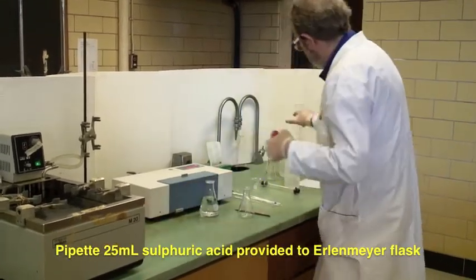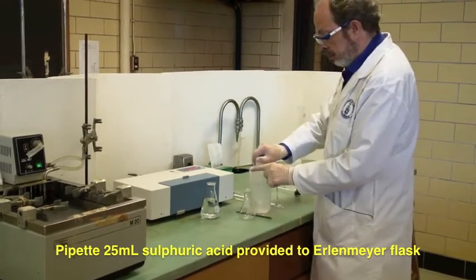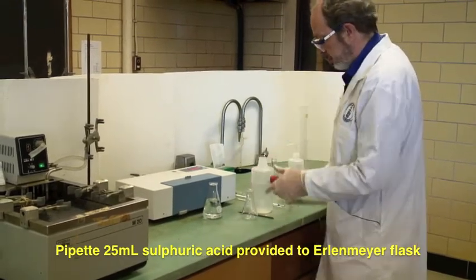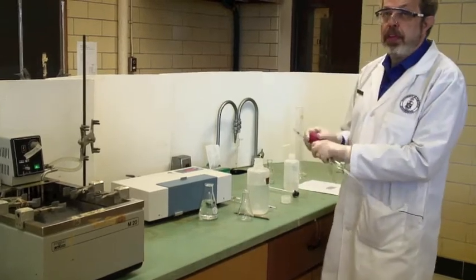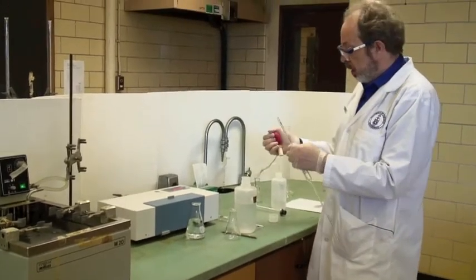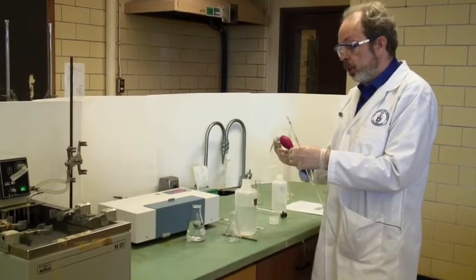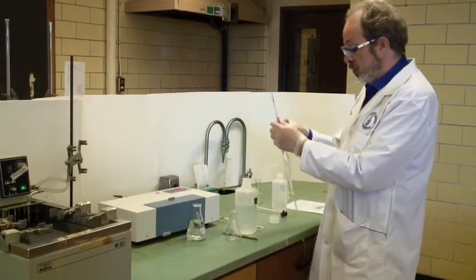There's my pipette bulb. Here's my sulfuric acid. We've provided you with two pipettes. Make sure that you don't mix the two, because if you use the same pipette for both, you're going to start the reaction before you want it to.